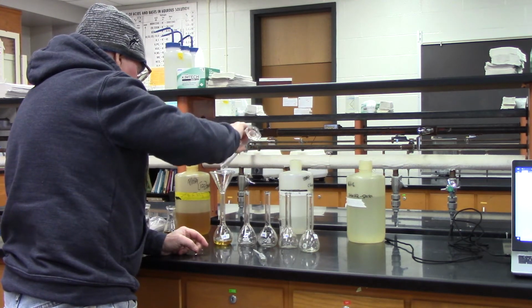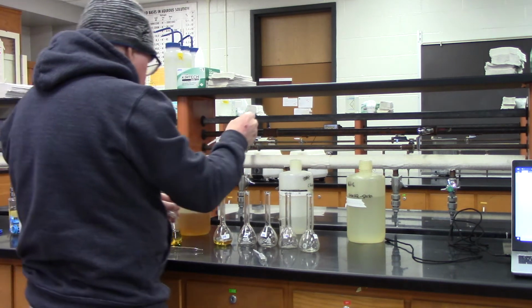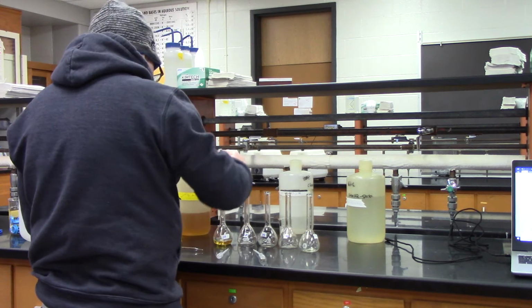Okay. I'm going to rinse a little bit with my nitric acid.